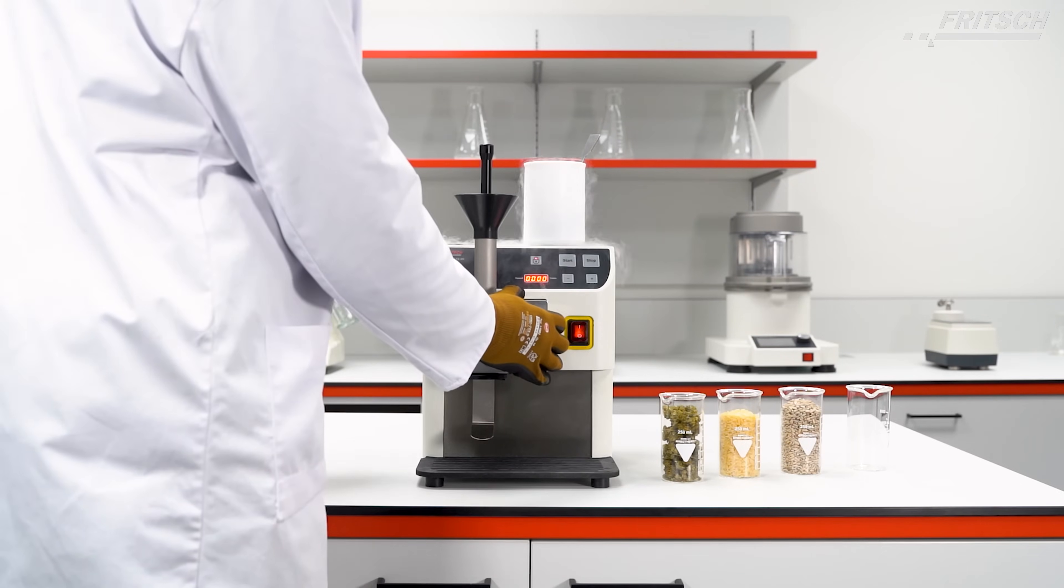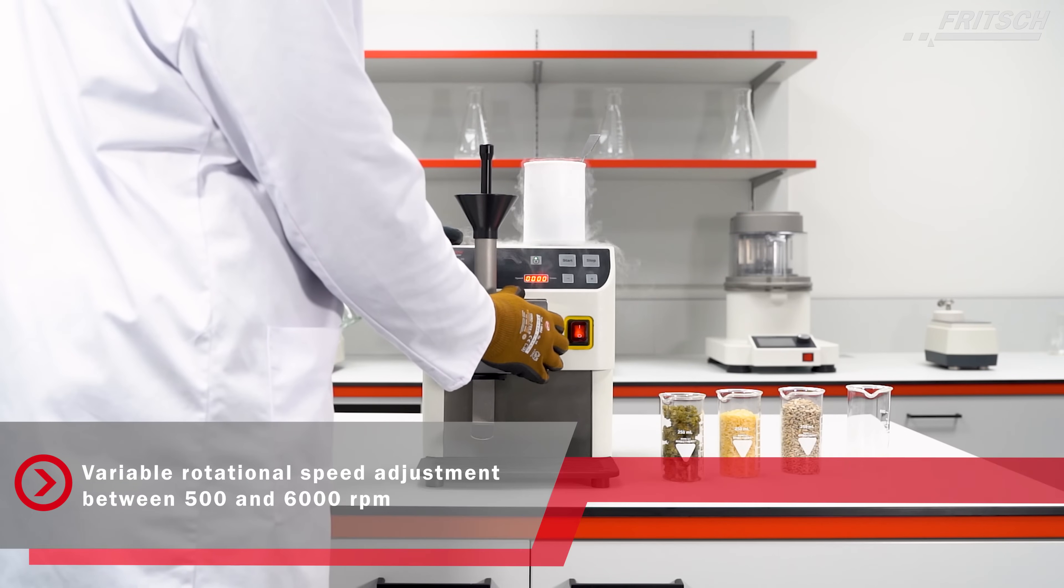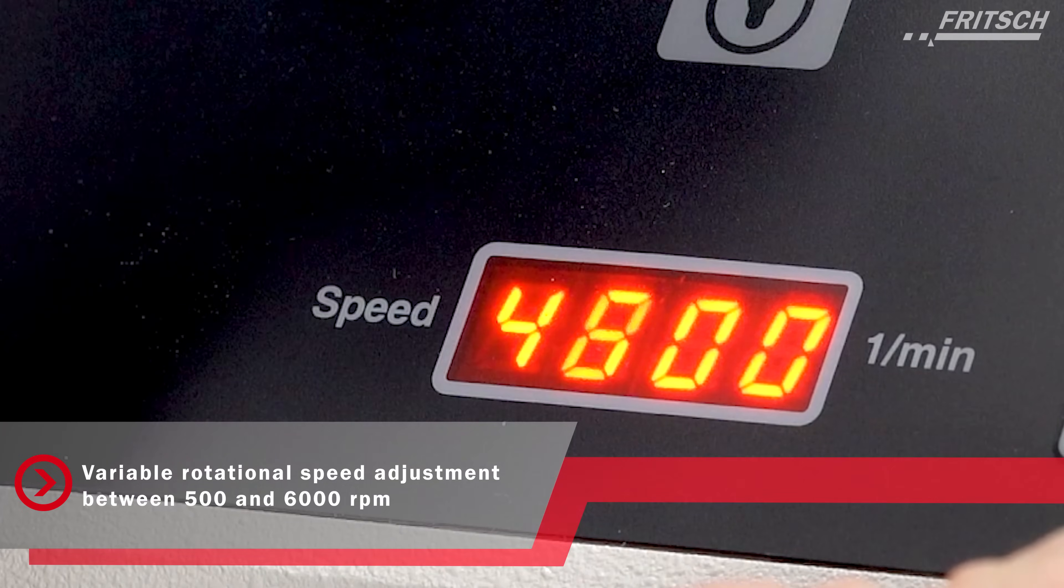Turn on the device and adjust the RPM to meet your specific requirements for fine-tuning your comminution process.